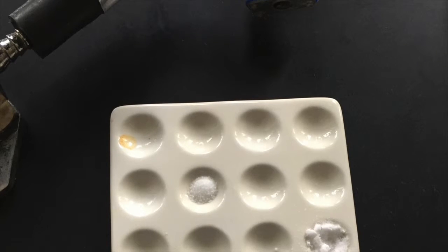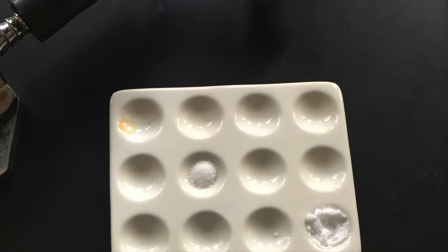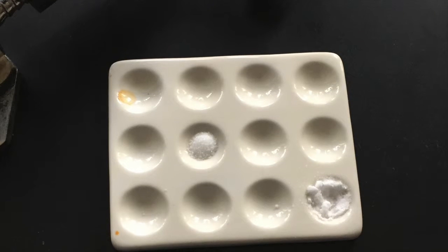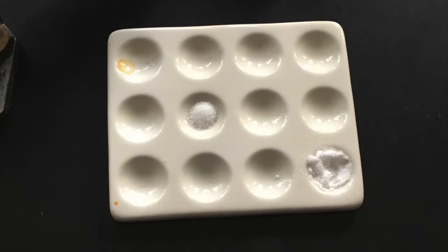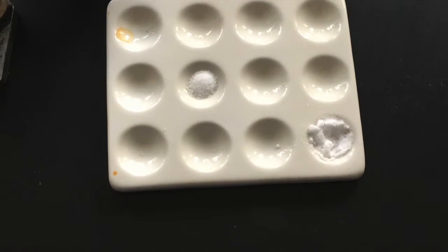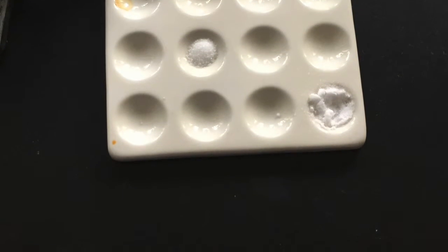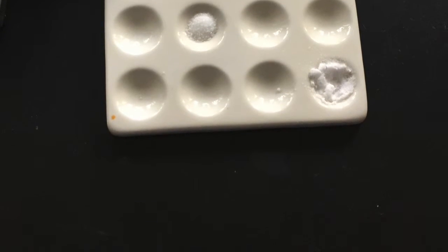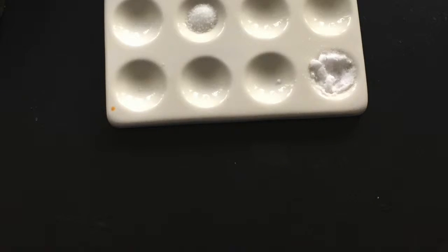After the flame test, an odor test was conducted. In the odor test, each group member wafted the smell of each unknown substance into their nose. The group was expecting good results. However, the group was also surprised to learn that there were no distinct pungent smells that separated the different substances from each other. Therefore, the odor test did very little to help the group minimize their window of what they thought the substance would be.